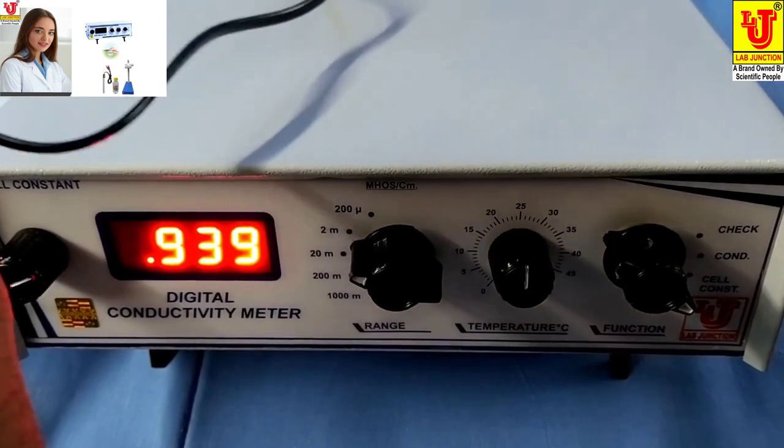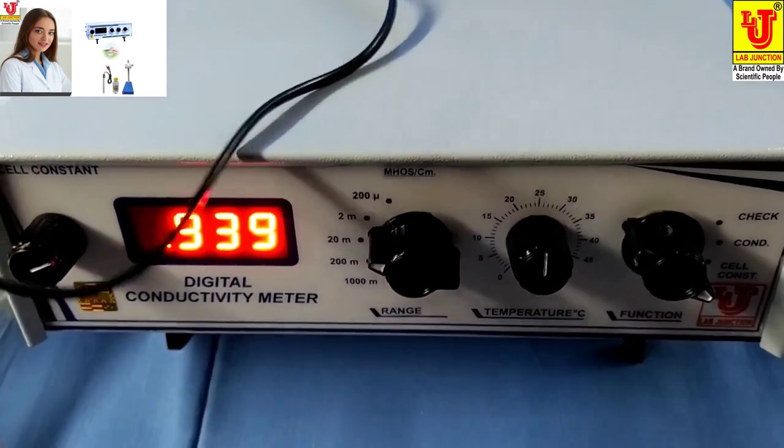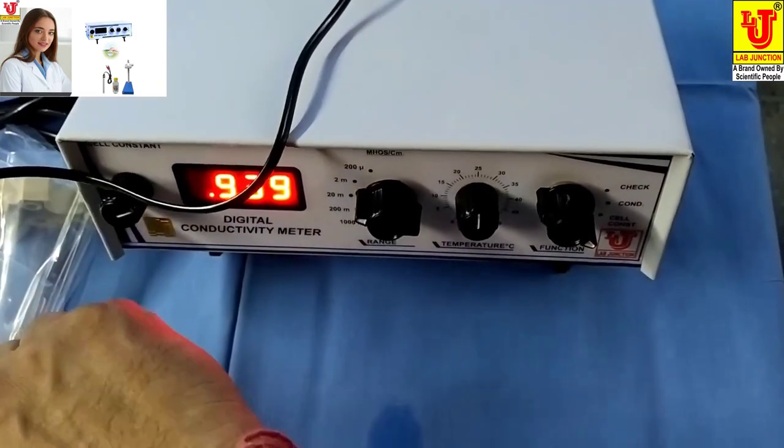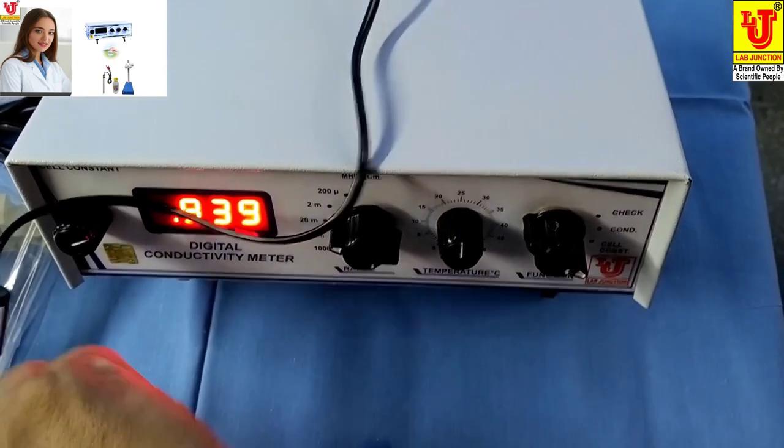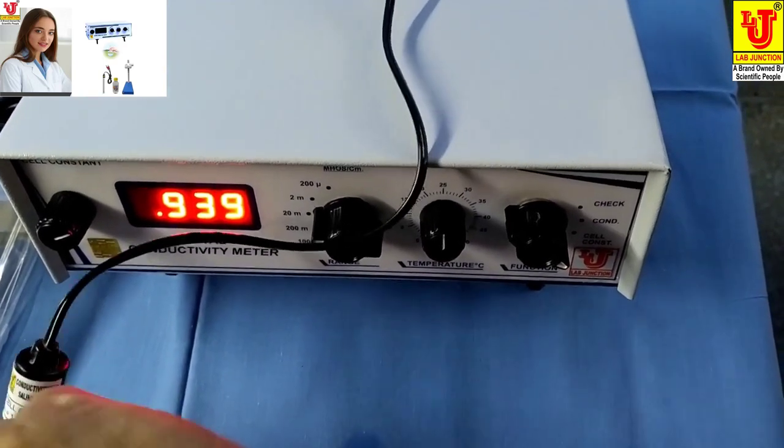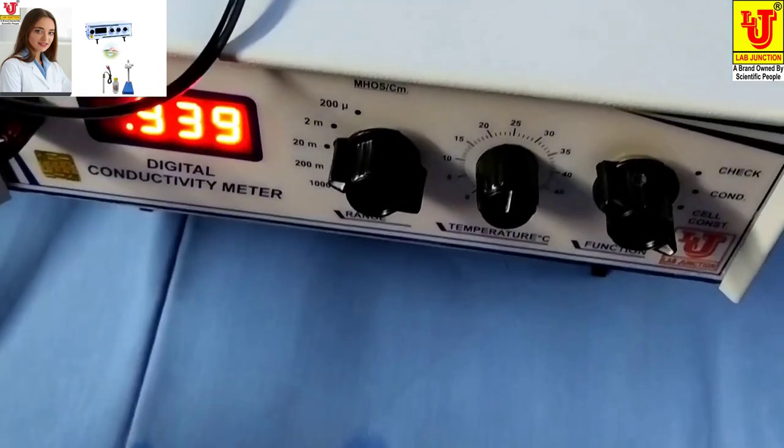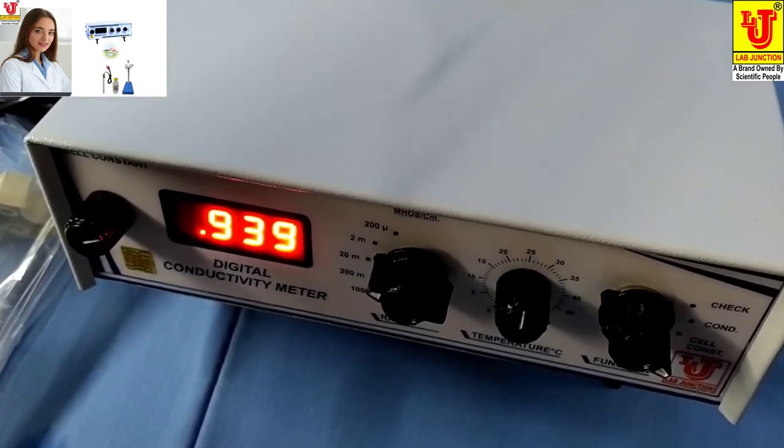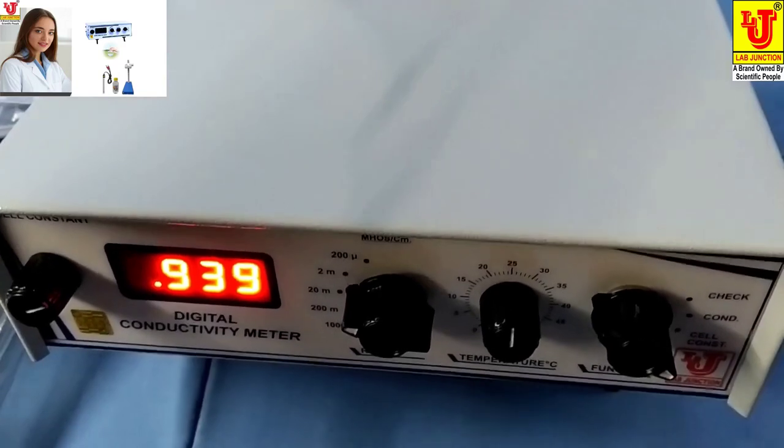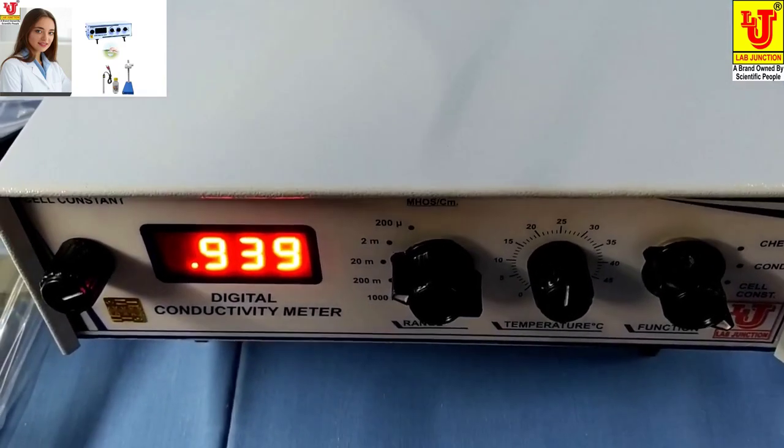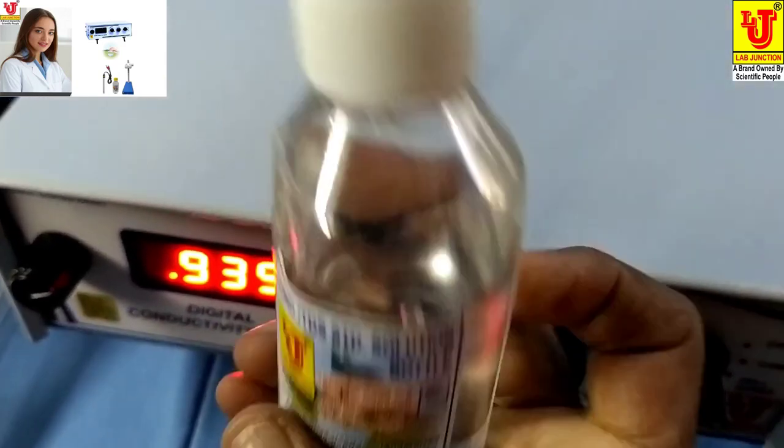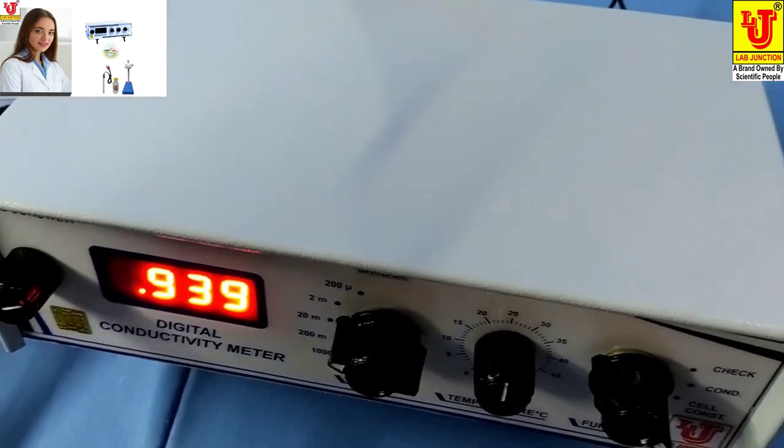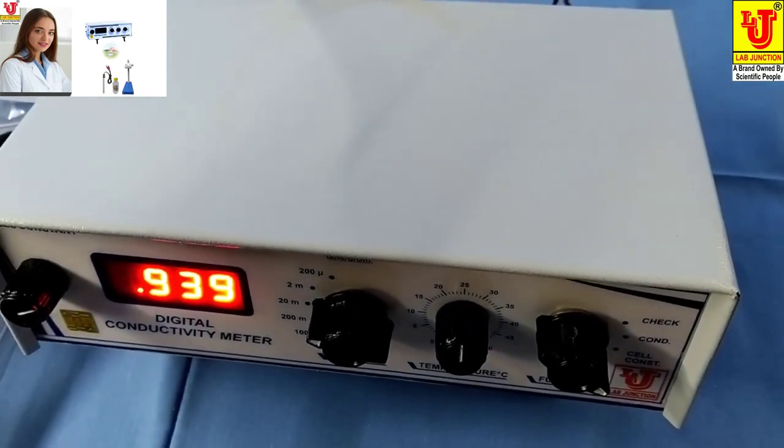Suppose you can leave your premises and you come again to your premises after a week. Now it is very necessary to work again, but you don't have this conductivity solution. How can you calibrate?